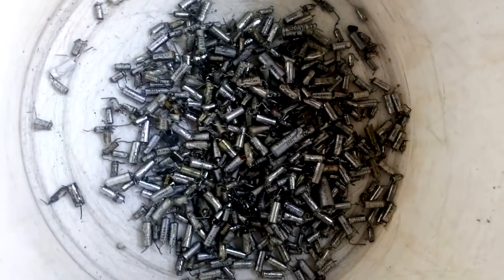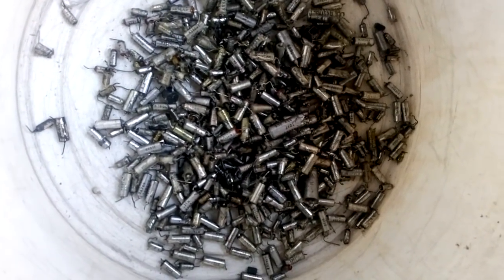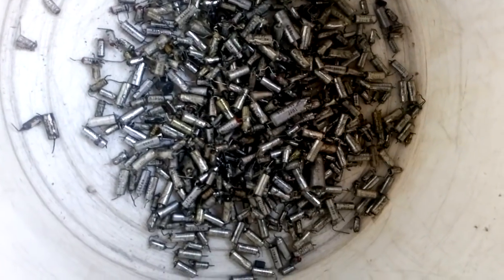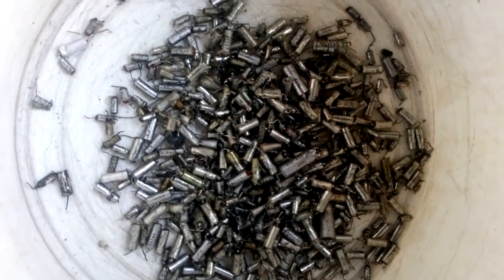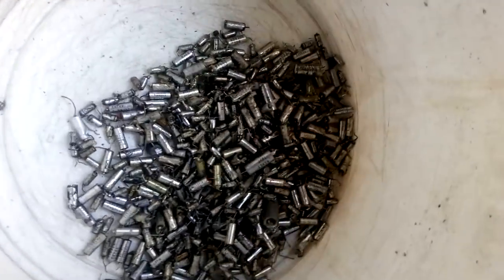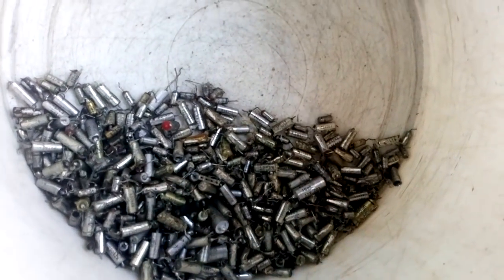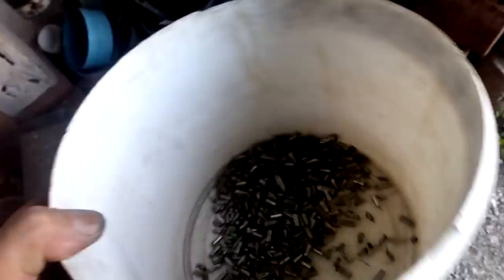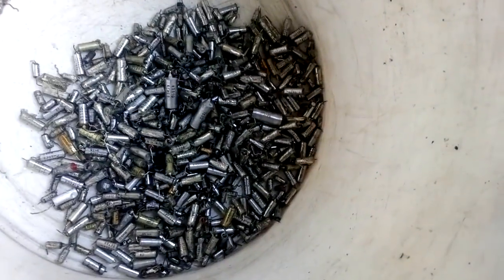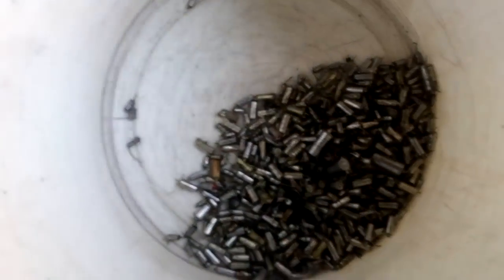So I don't have the patience to remove all those foils from every canister. So on the little ones I just scratch with a knife and open the metal to the acid. And I hope that will work. So now we'll just add nitric acid to that.